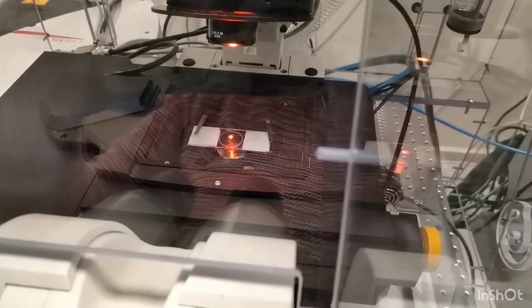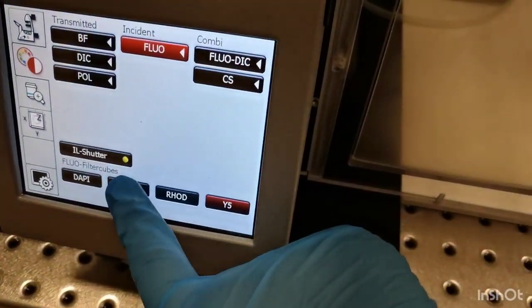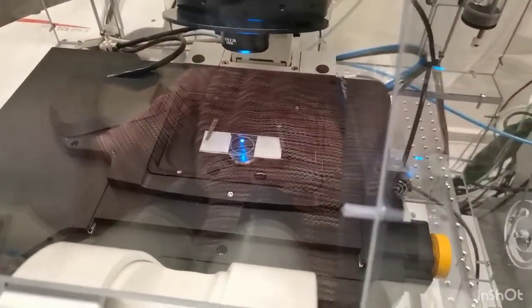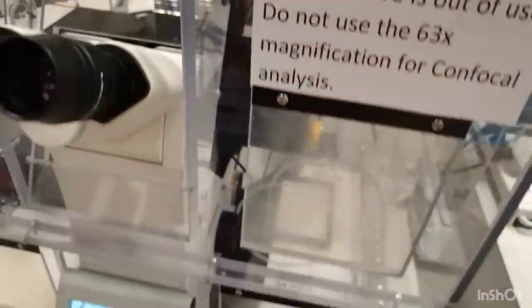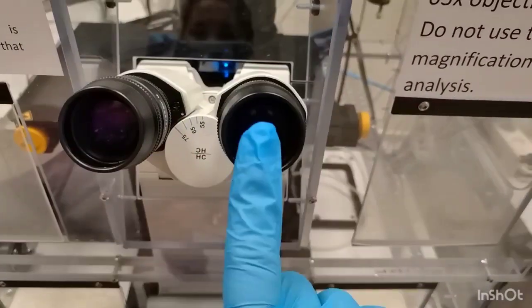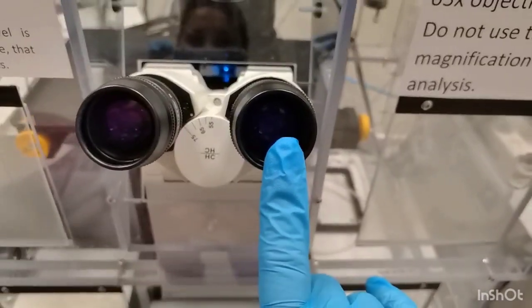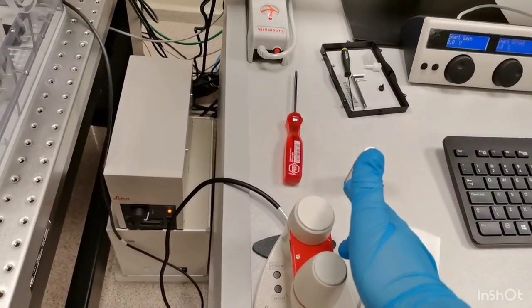And please note in this position that the objective is still very down, and there is quite a lot of spacing between the objective and the sample. Do not touch the objective with the sample while you move the stage. Then I put the scanner head down gently. Now I look through the binoculars. Do not, by the way, look into the laser directly.